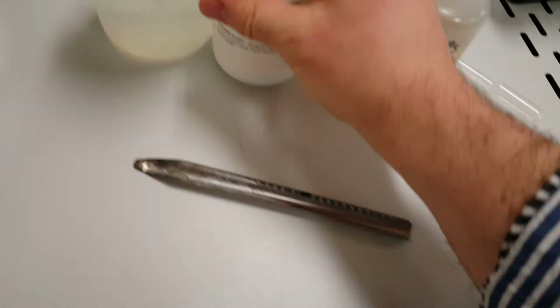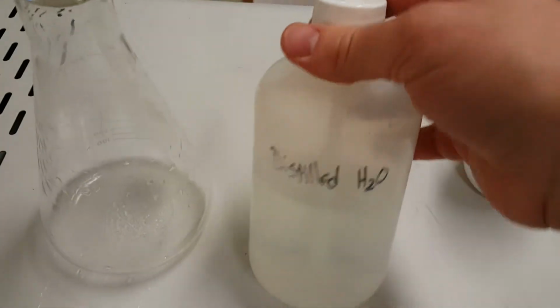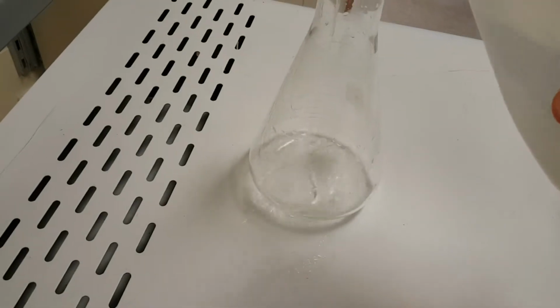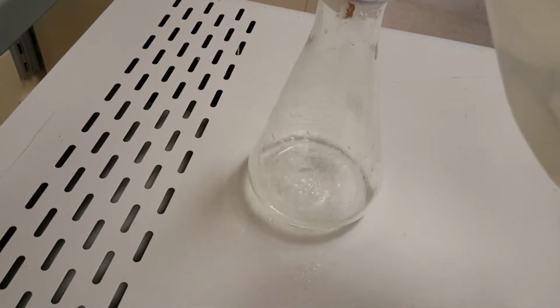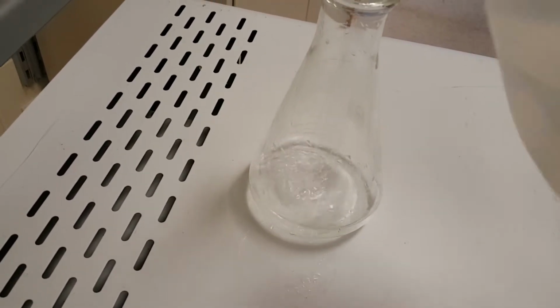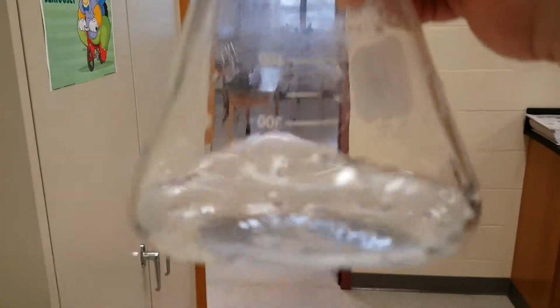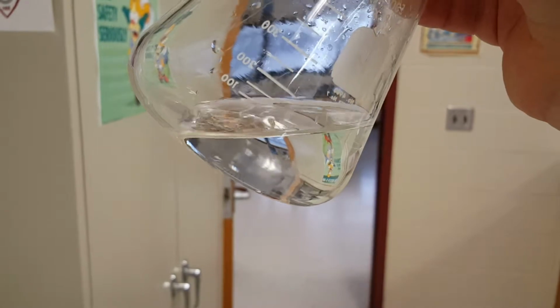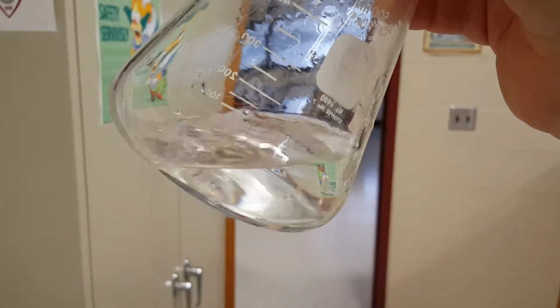That little amount of stuff we'll call the solute, because it's minute. It's a little bit. And to that, I'm going to add a solvent. H2O. This stuff is known as a universal solvent, water, because it does a really good job at dissolving all sorts of chemical compounds, especially ionic and polar covalent compounds. So now if you see, there is no actual solid left in our liquid.